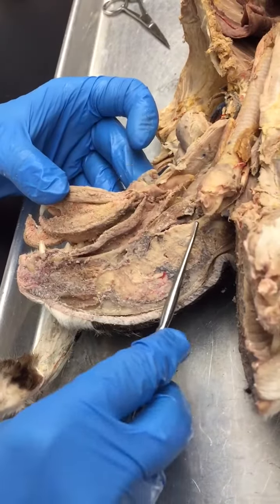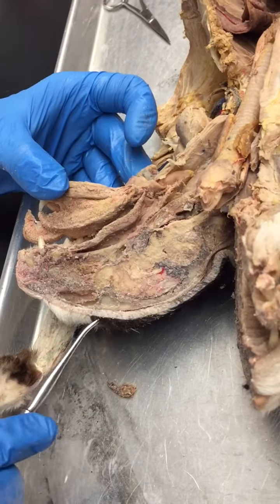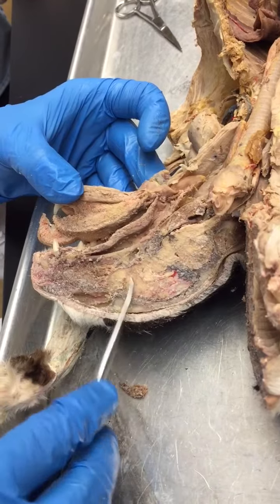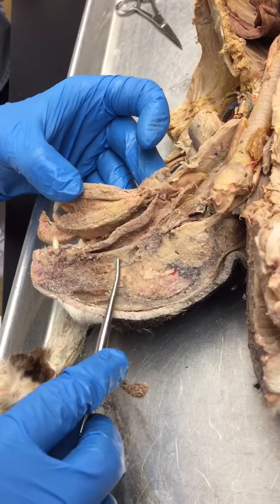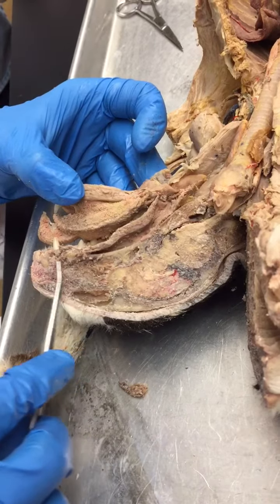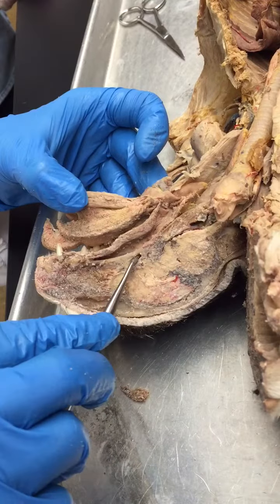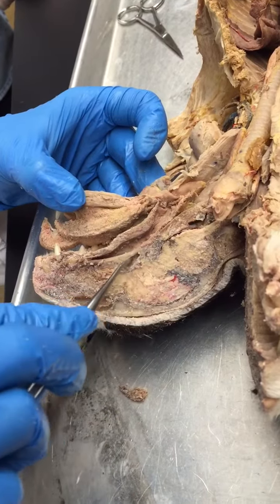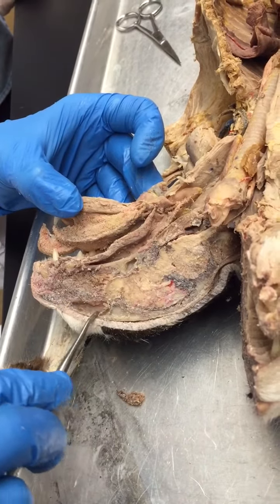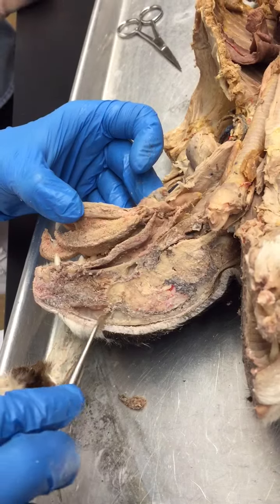We've cut the cat's head in a mid-sagittal section. This is the top of the head here. You can see the brain, and anterior to that you see the nasal cavity. This is the sphenoid sinus right here, and in this area this is going to be the frontal sinus.